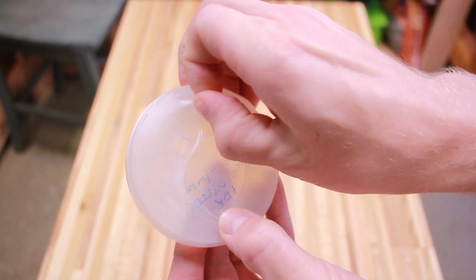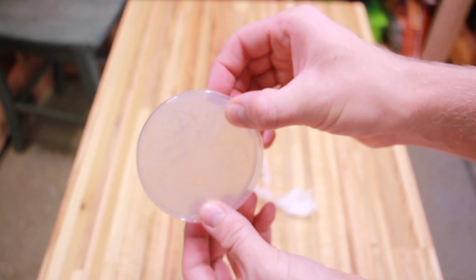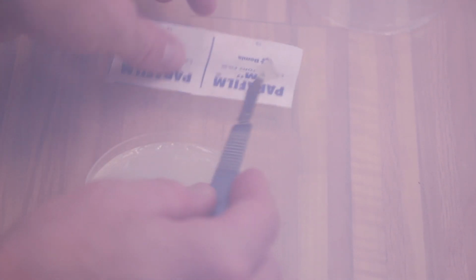So I'm going to be using a culture here from a pink oyster grow that I did a while back. And this is pink oyster that's been on agar for a few months. I'm cutting the agar inside my still air box because I don't want to contaminate my agar here.